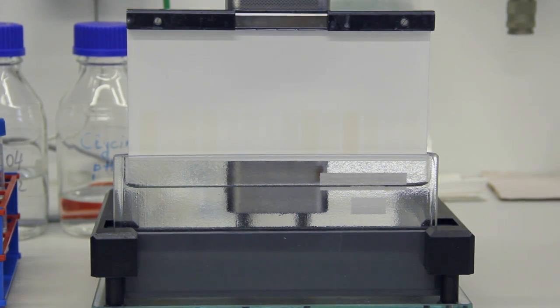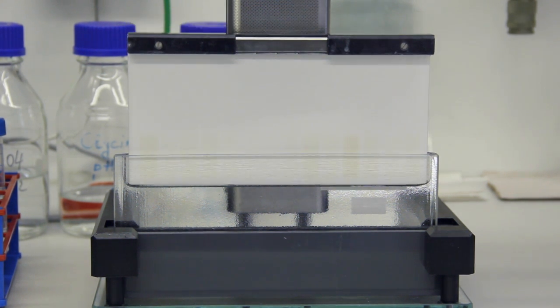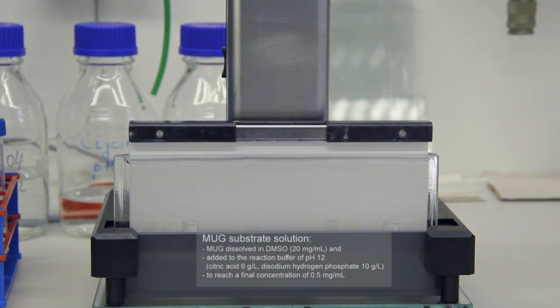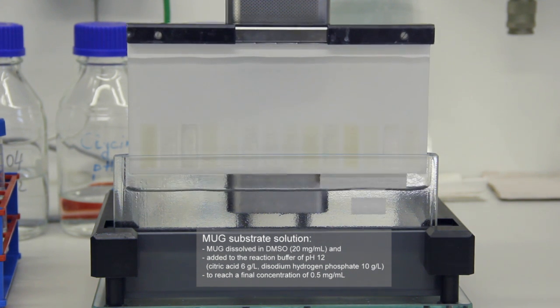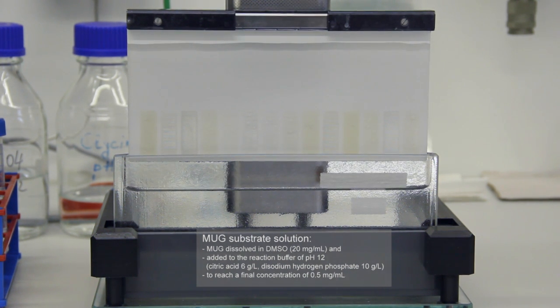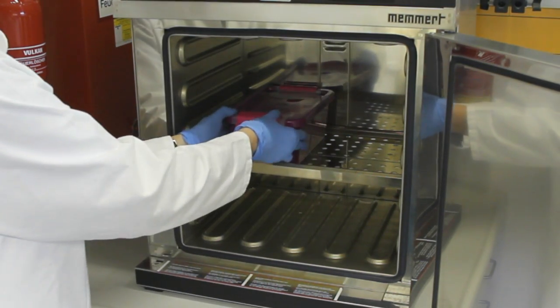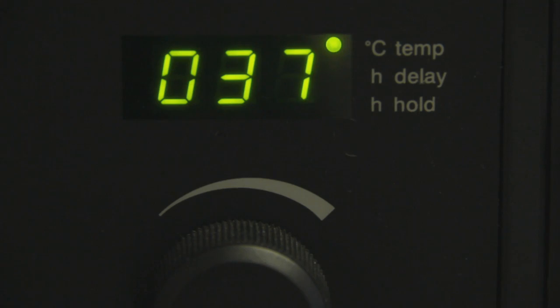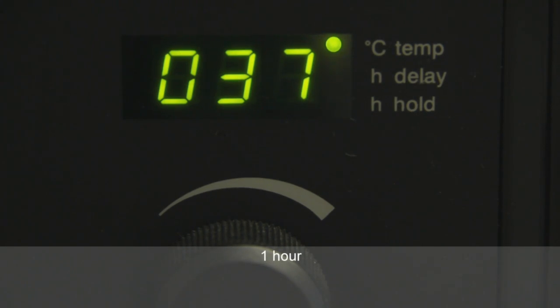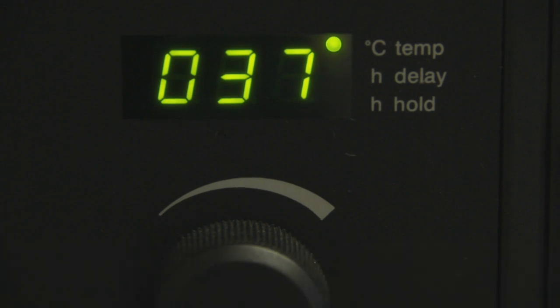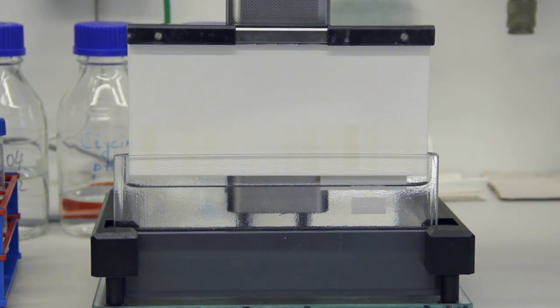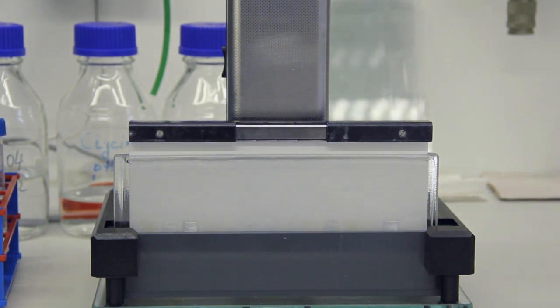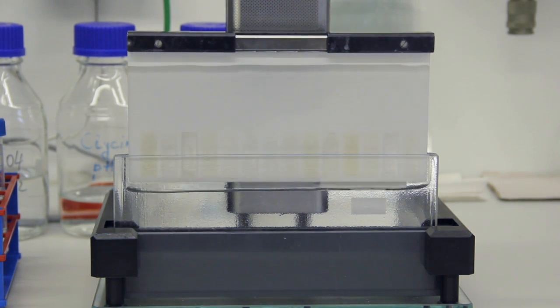After the plate had been dried for 2 minutes, the plate was immersed into the substrate solution, which was 4-methylumbelliferyl galactoside MUG. The reaction with the MUG substrate solution was intended for determination of the released galactosidase, which cleaved the galactose from the MUG. Thus, the blue fluorescent methylumbelliferone MU was formed during the second incubation period of 1 hour at 37 degrees. The substrate reaction was terminated by immersion of the plate into solution of glycine and sodium hydroxide, 0.1 mol, pH 12.